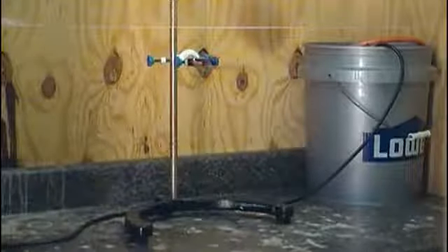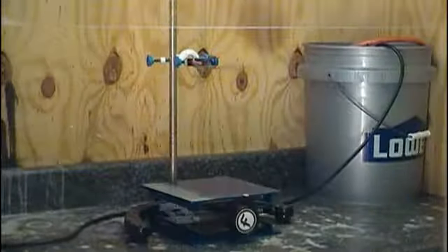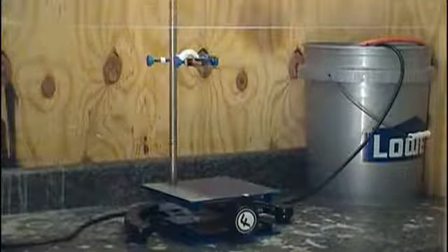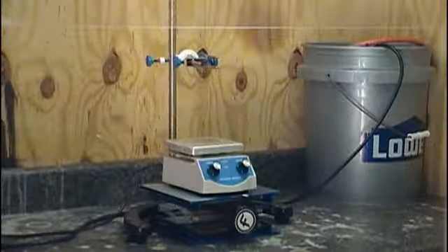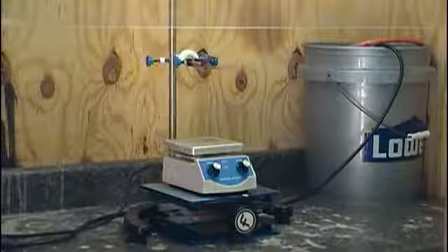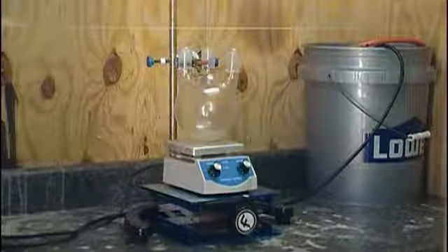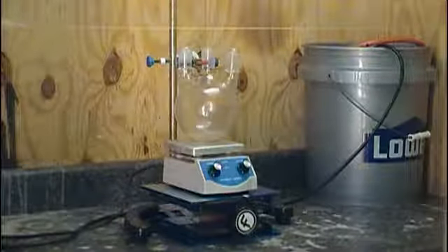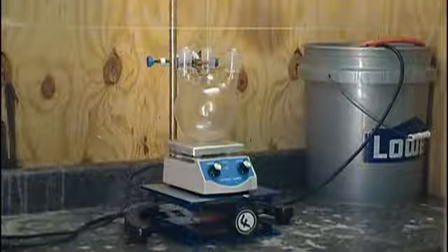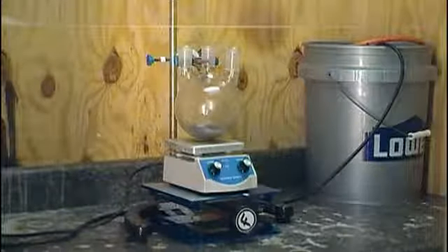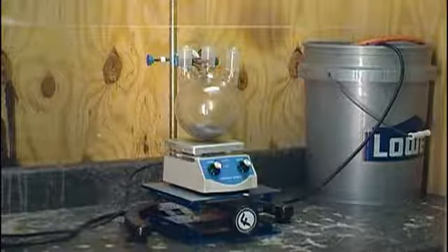Now in a fume hood or outside, place a sturdy stand with a clamp attached. Then set a lab jack under the clamp. On top of that place a hot plate. Now clamp in a 1 liter 3-neck round bottom flask. Place it so that it is gently resting on the hot plate. To the flask, add in the iron powder and then the water.